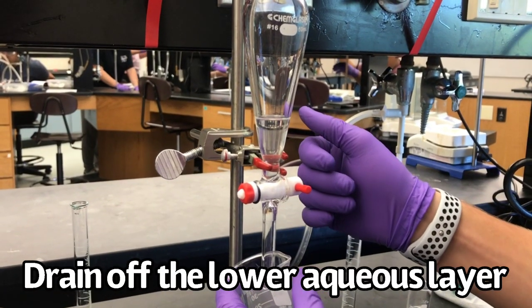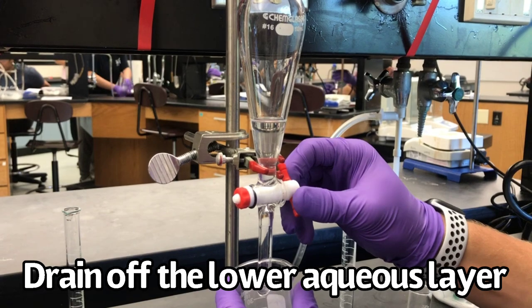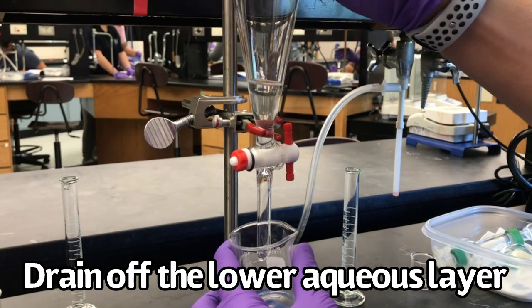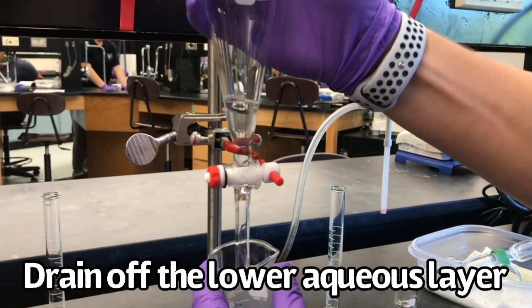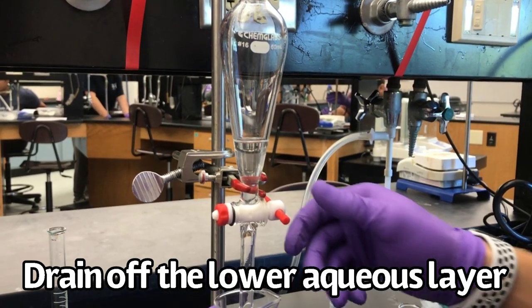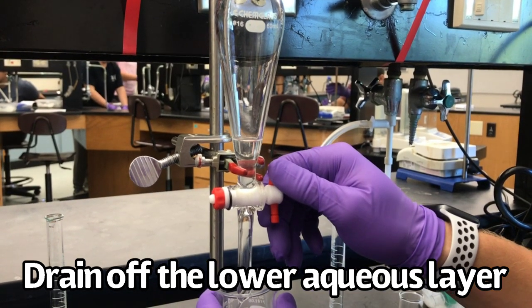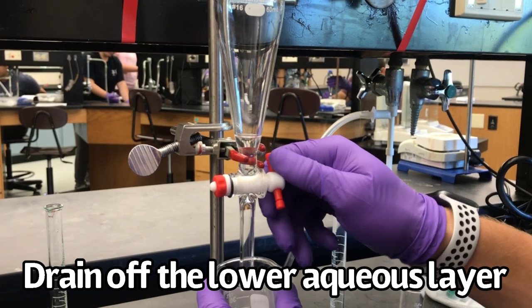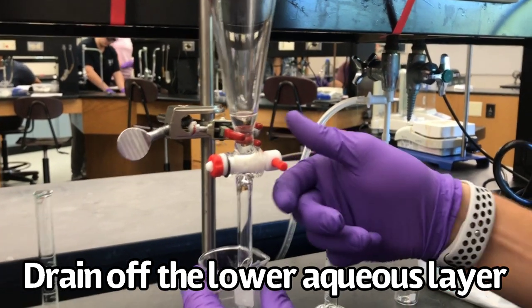Drain off the lower aqueous layer so that only the organic layer remains.